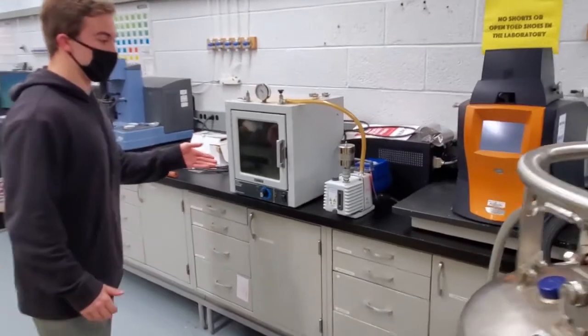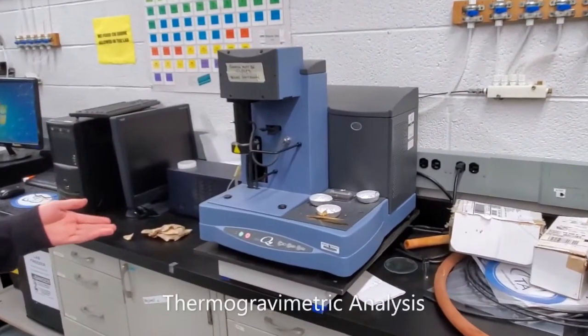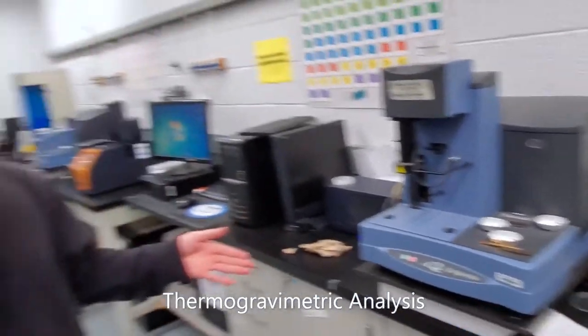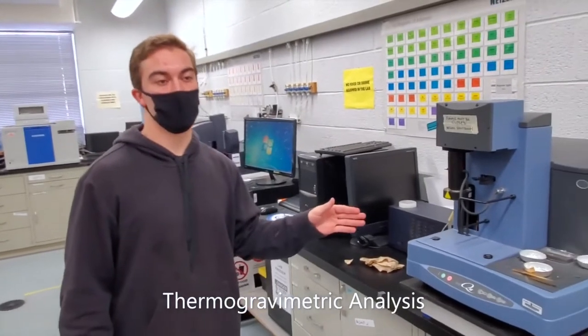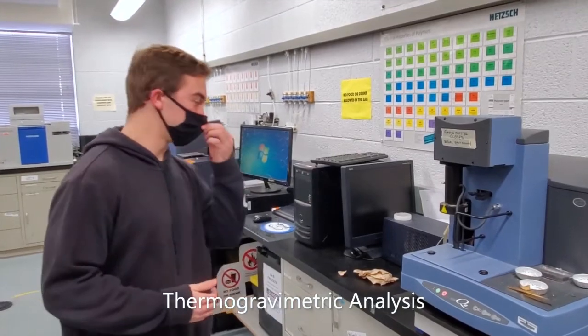Then moving on to the next device, this is a vacuum oven, so this can pull vacuum and heat your sample at the same time. Then we move to the TGA. This stands for thermogravimetric analysis. So this tells us at what temperature materials degrade, and this can kind of show us how much water and what the material is made of.